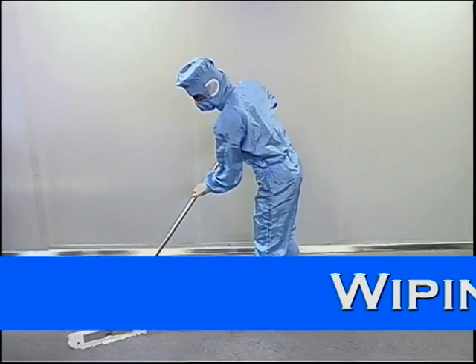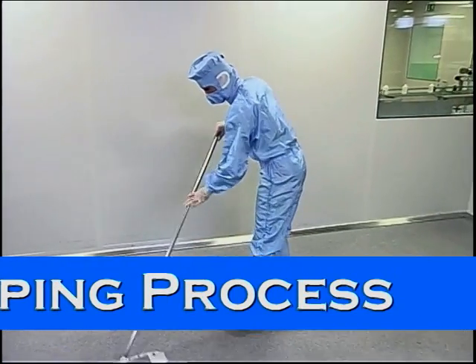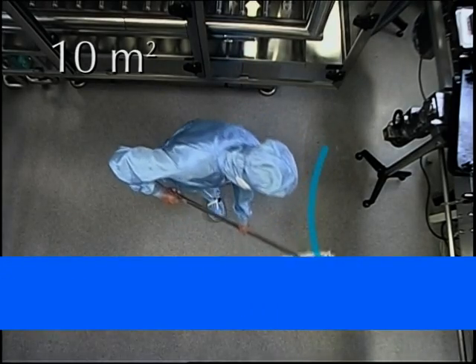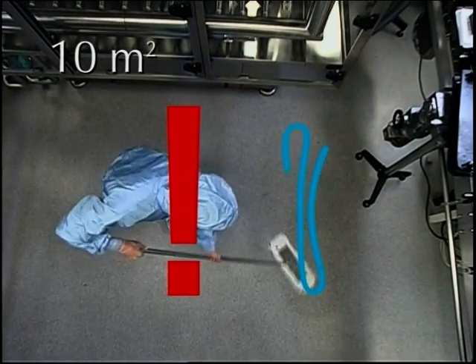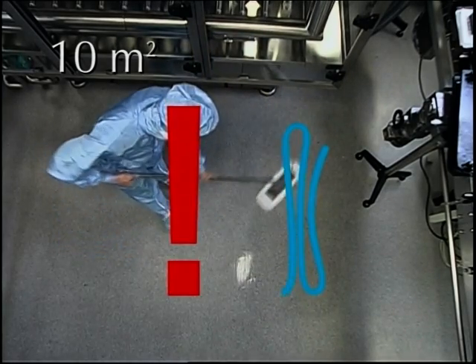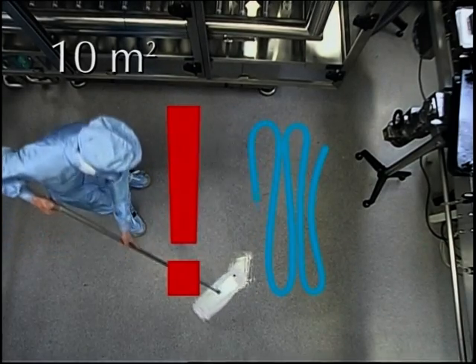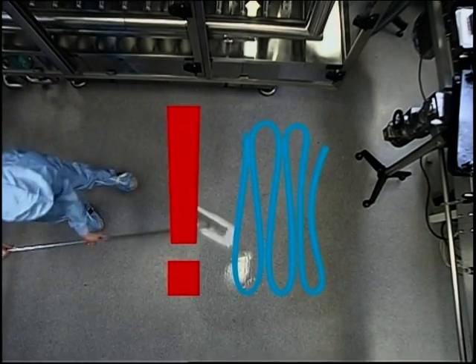Now to the wiping process. In essence, the wiping process itself is carried out in circular movements or, as we experts call it, in figures of 8. In this way, we can wipe about 10 square meters of floor area evenly and without leaving anything out, while walking backwards. Let me show once again.